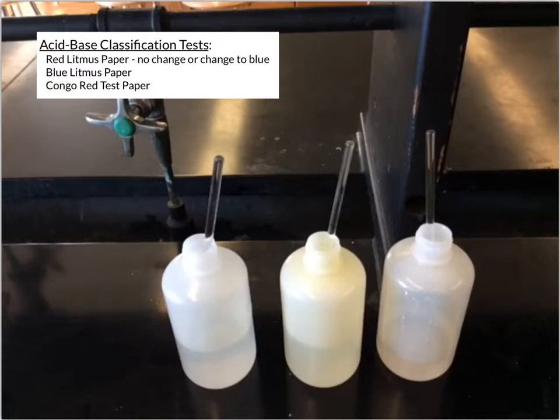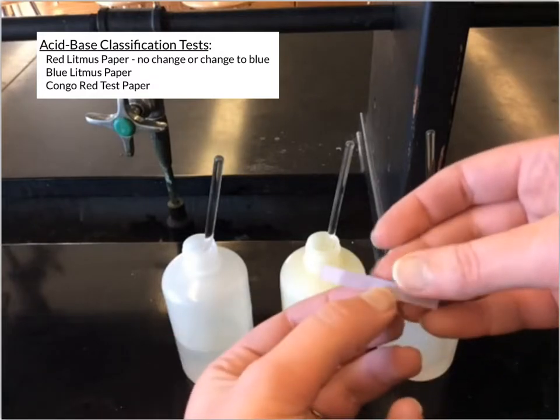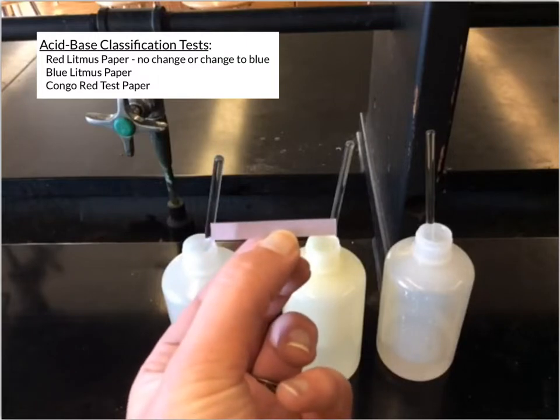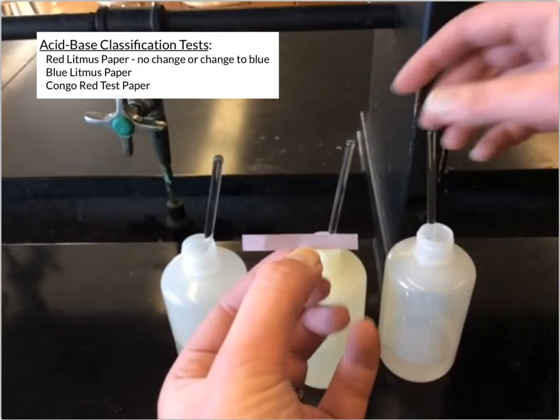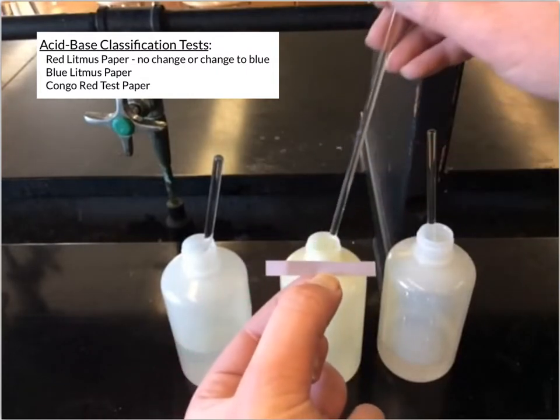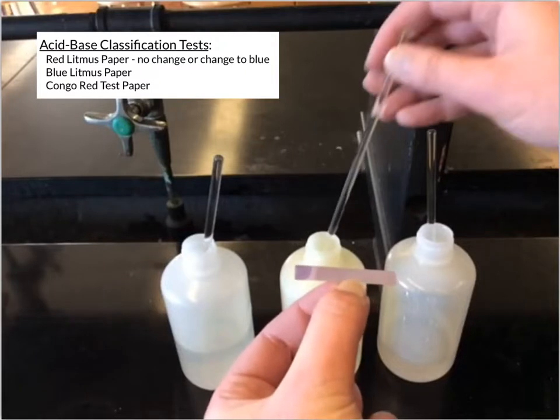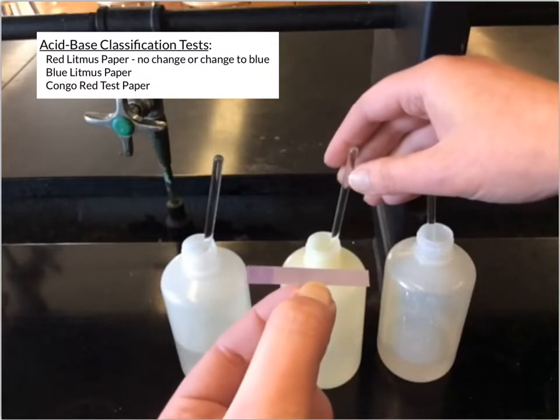Now, another type of litmus paper we can use is blue litmus paper. So blue litmus paper, as it sounds, starts blue, and it's kind of this light blue color. And you could test a substance, and it could cause that blue litmus paper to have no change. Okay, so it's still blue.